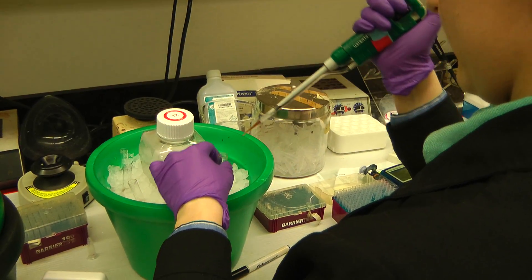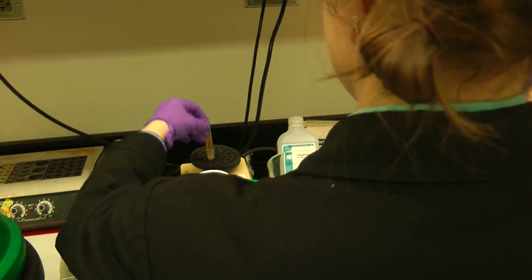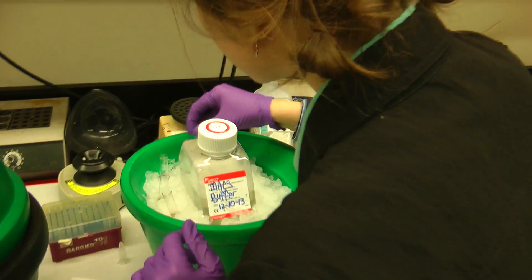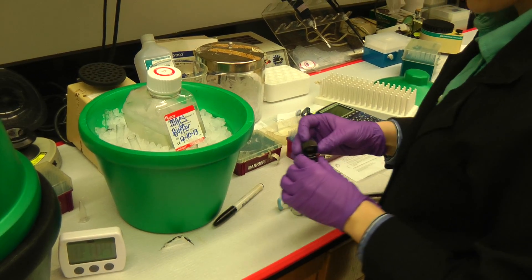You've got to balance between what the protocol says — the sort of like the optimal — and at least enough, without using all the beads up at one time.